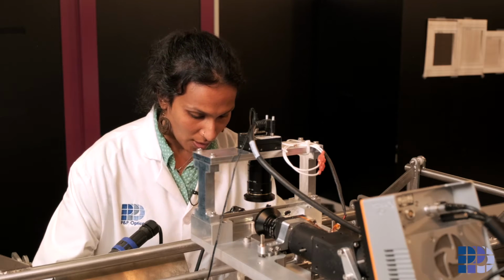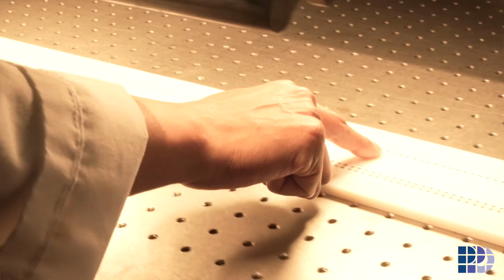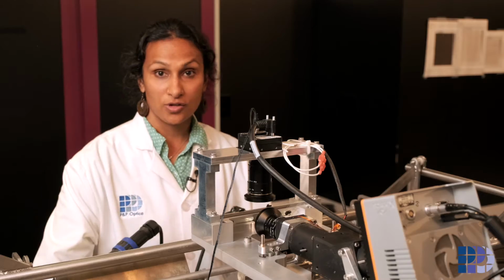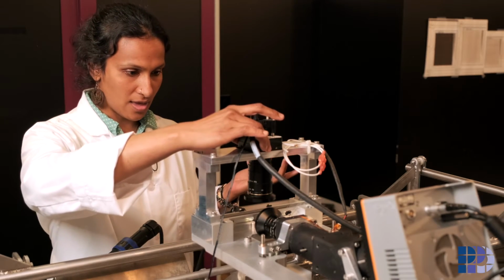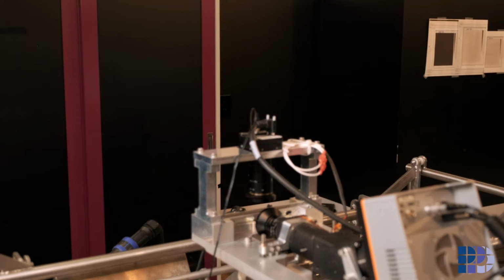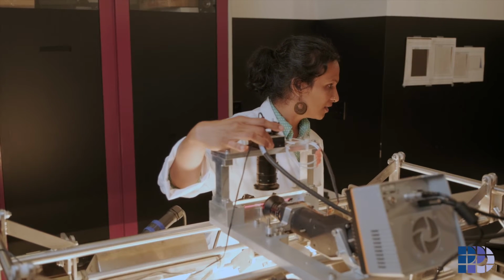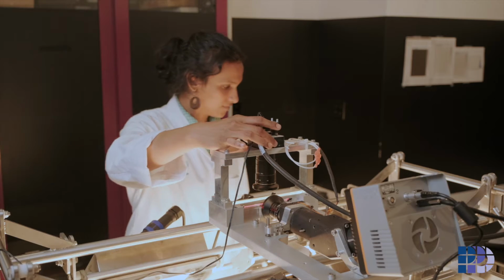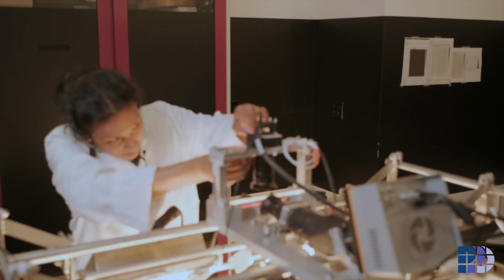So to start that, here is the target with dotted lines, and it is set up on the table such that it is going to be parallel to the belt. And then I'm going to move the visible camera first and ensure that I'm seeing all the lines in its field of view. So to do that, I'm going to turn the lights on. Here I am adjusting the visible camera, and I'm moving it enough so that I'm able to see all the lines. I'm going to tighten it up here.